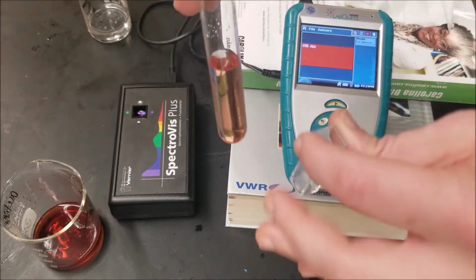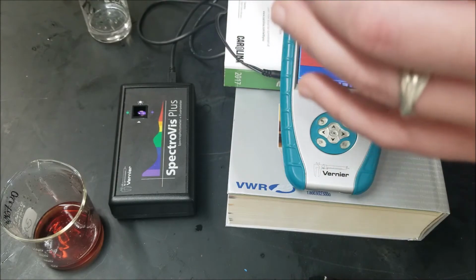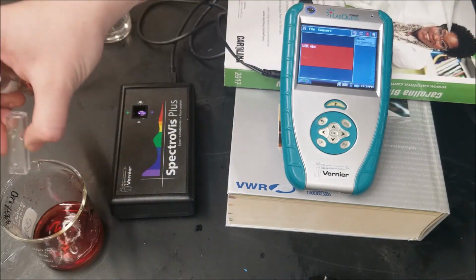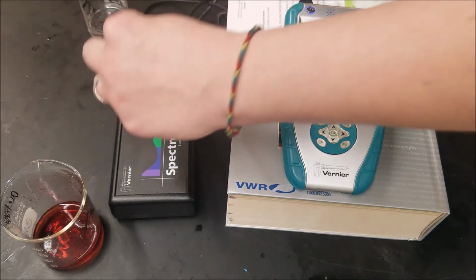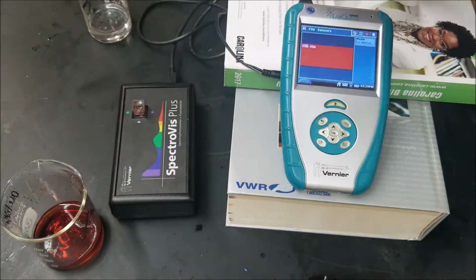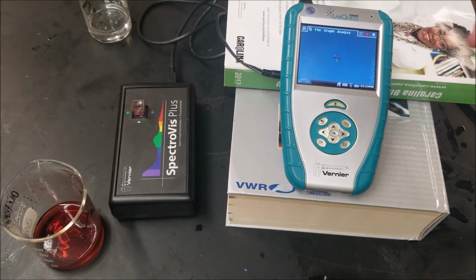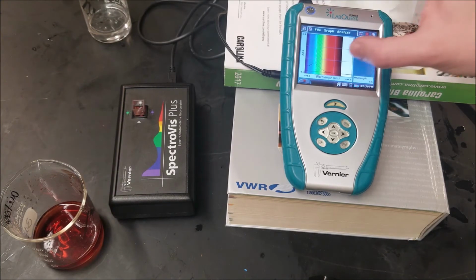But one thing I want to do is first pour a little bit of sample 1 into there. Oh, a little bit too much. That's fine. A little bit of sample 1 into there to coat the sides. Put this in here. Measure my lambda max. So hit play. Stop.